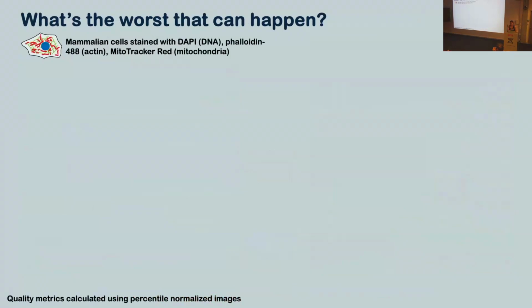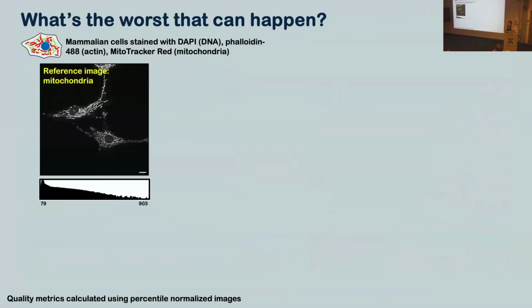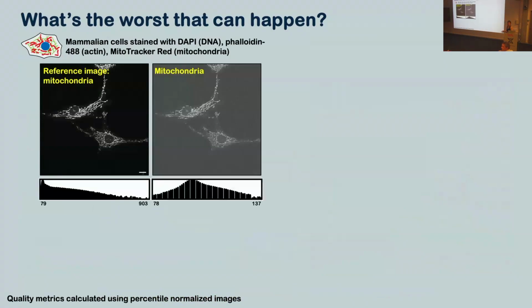Finally, to finish off, the question that usually ends every talk, which is what's the worst that can happen? So this is some 3-color imaging I've done. And the reference image that I'm going to use here is mitochondria. So I've got a nice high quality image of some mitochondria here. That looks pretty nice. What I've been doing the whole time is imaging the same structure, but at a lower illumination dose. And so you can see it's the same structure, but it's kind of noisy.